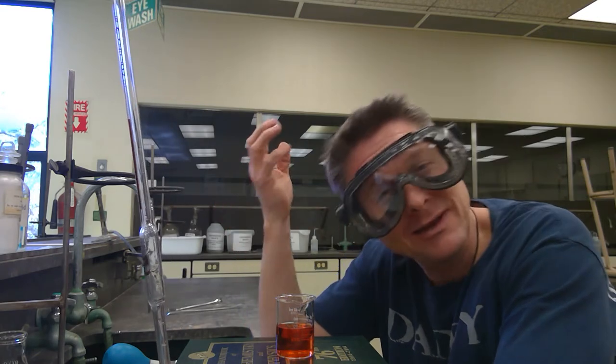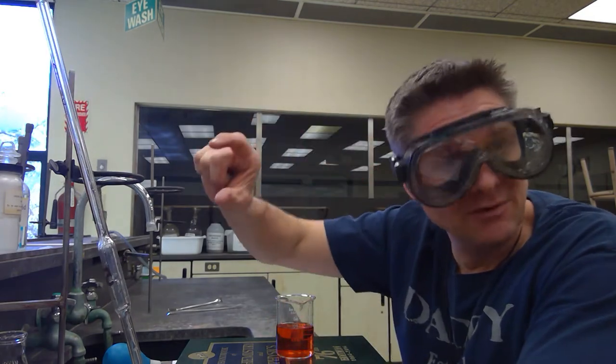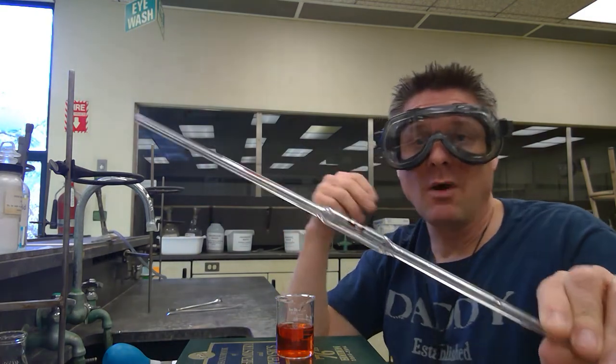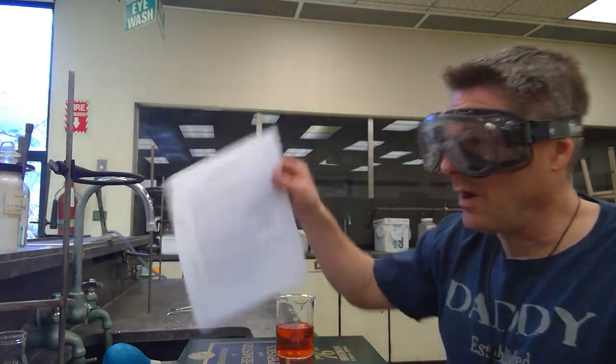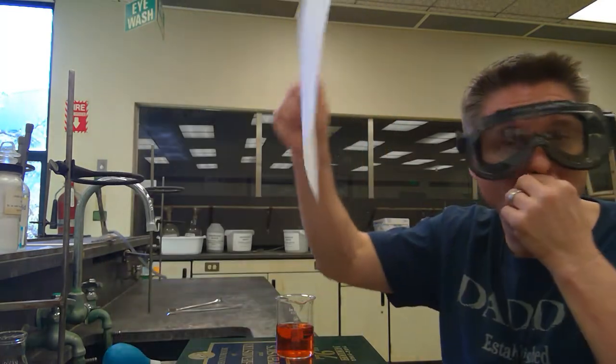We're going to be calibrating our 10 milliliter one. There are some cute ones that are one milliliter — a lot of different sizes. You also have a measuring pipette, where you record the initial volume, drain out however much you need, record the final volume, and then calculate final minus initial to get the volume dispensed. So that's a measuring pipette where you can do variable volumes. We're going to be mostly using these transfer or volumetric pipettes. The key on the instructions here talks about what to do with all of them.